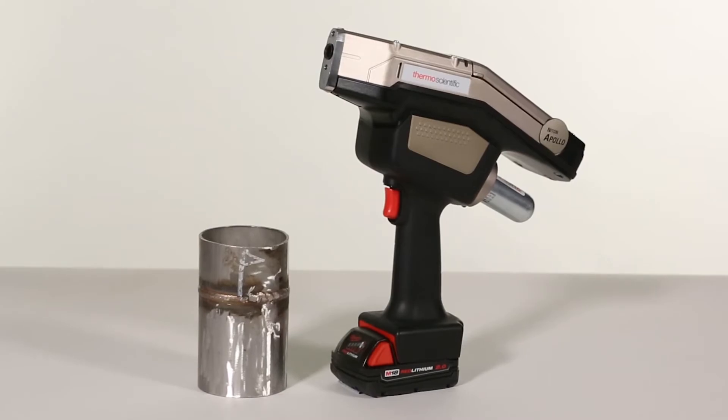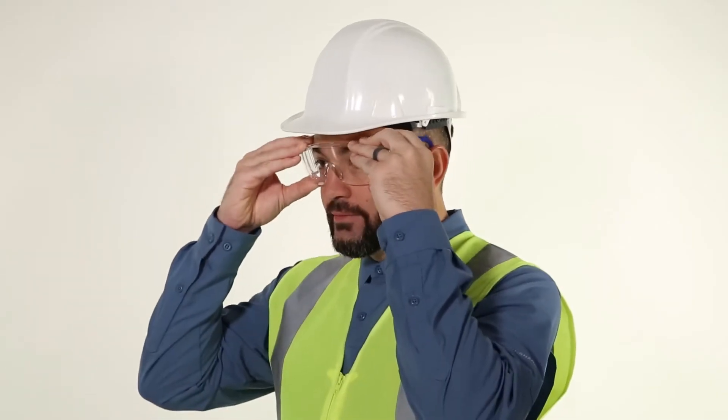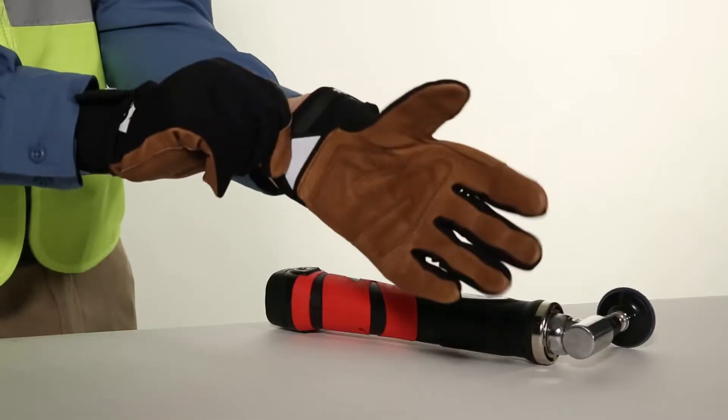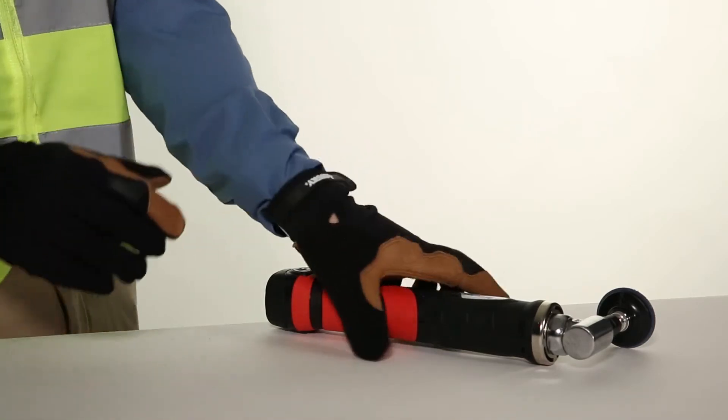Before we begin, safety is our top priority. Be sure to wear safety glasses and gloves when using high-speed grinders to prepare samples.